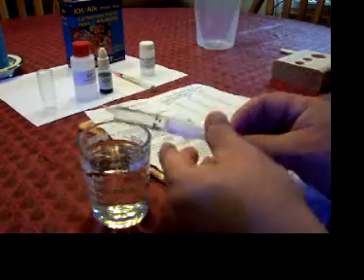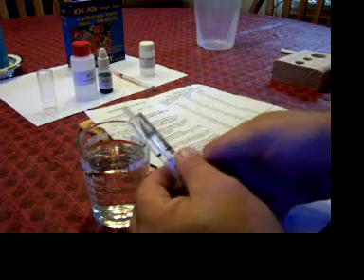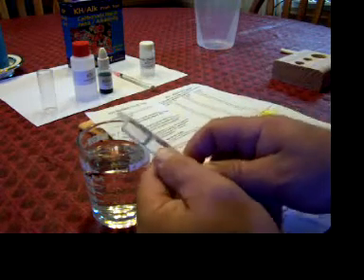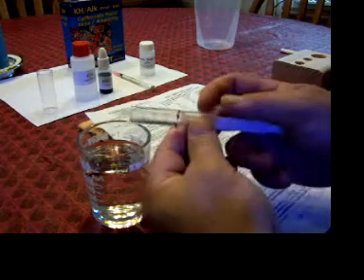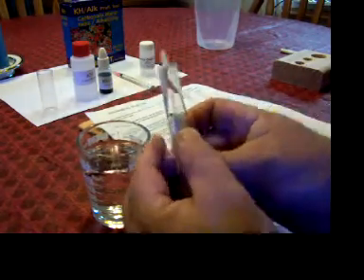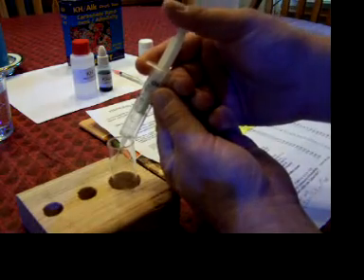So that's what we'll do here. I got it pre-marked. So let's see if we can get that air bubble out of there. There we go. Okay, we have four milliliters. I don't know if you can really see that but that's where it's at, the four milliliter mark. Put that aside. I made this thing so it holds some of my test tubes. So we're going to put four milliliters of water from the tank into this jar here.